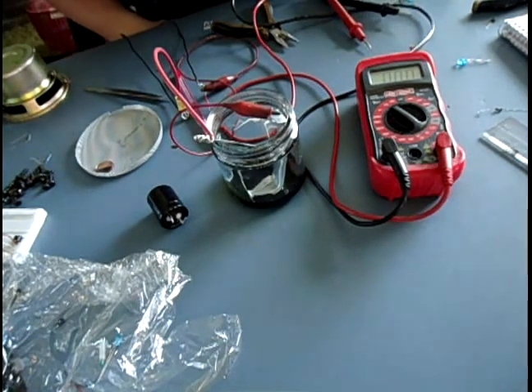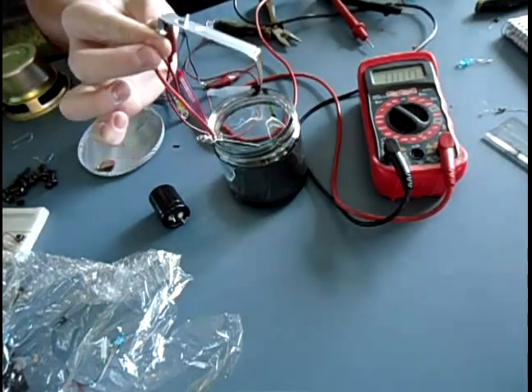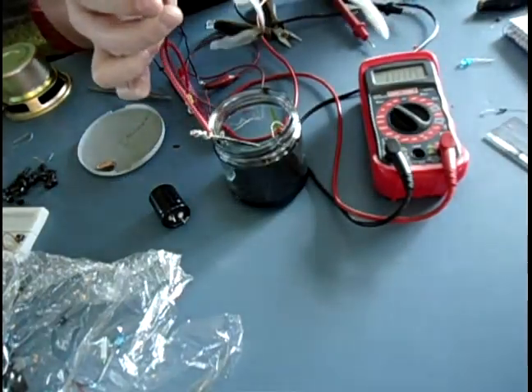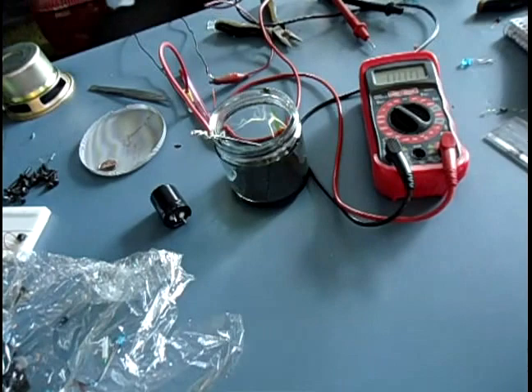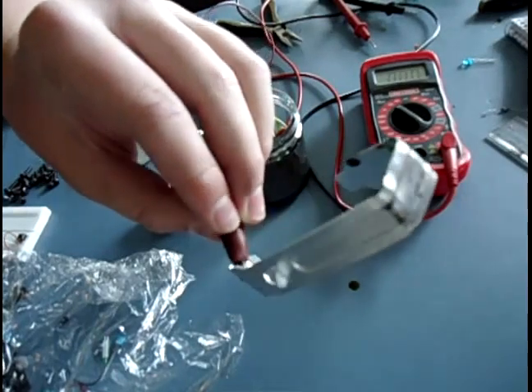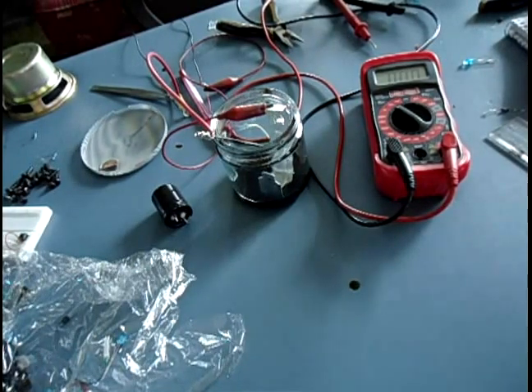So it's actually been about a minute now. I'm going to pull my cathode out here, and you can definitely see that's kind of a coppery color to it. I'm going to actually wipe it off a bit. You can see a little bit of reddish copper look there — kind of hard to see, but you can see it. The copper is actually sticking to our cathode. It's not the fastest process ever, but it's actually working, which is good.